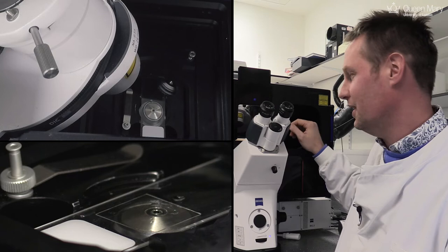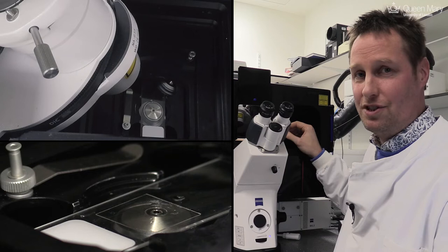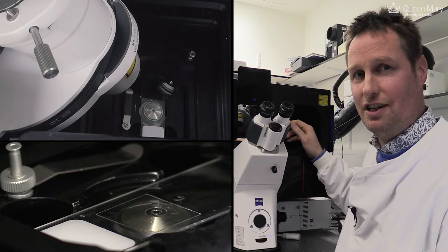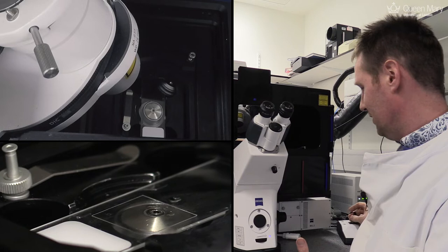We have put our sample on the stage, on top of our magnifying objective, to take a high resolution image of the cells that are on this coverslip. They are stained for microtubules, which are the cytoskeleton of the cell. They are also stained in a different colour for the mitochondria, which are the energy factories of the cell, and the nucleus, where all the genetic material resides.